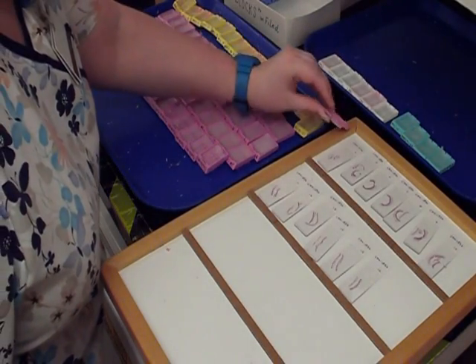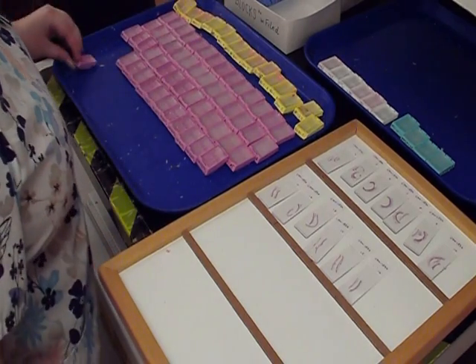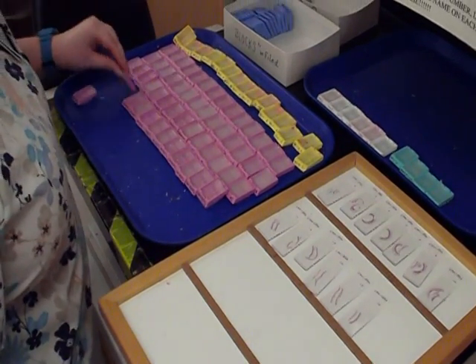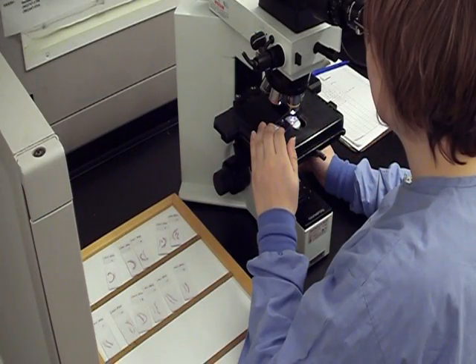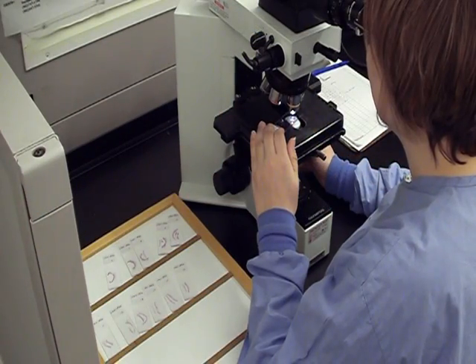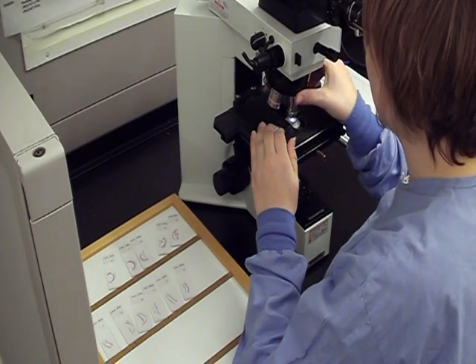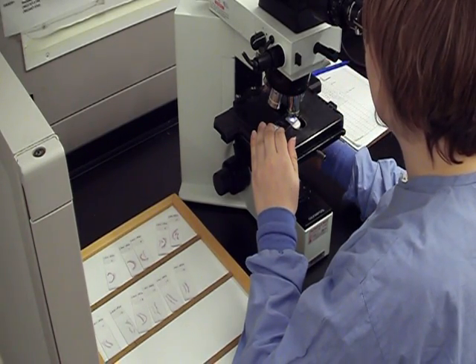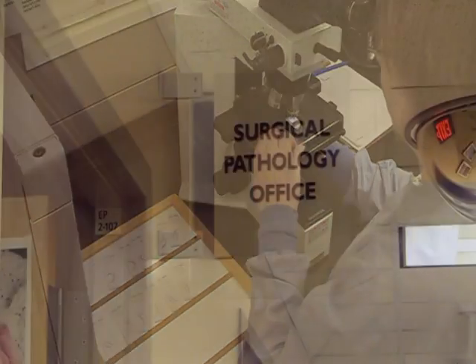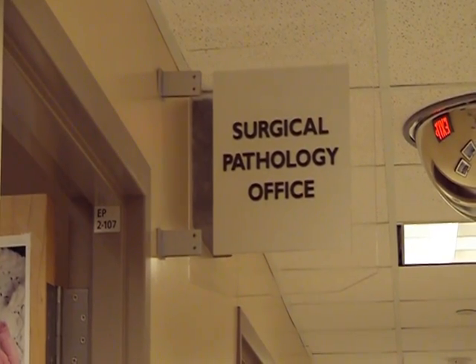Completed slides are compared to their respective tissue blocks to confirm that the specimen numbers match. A histologist checks each slide for quality and correct staining — a final check before the slides are brought to the surgical pathology office.